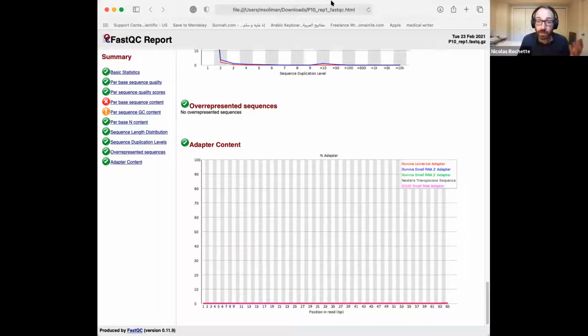Okay, so that's it for the FastQC report. One thing that appears here is that you might wonder where this goes. The thing is, here we're trying to rule out errors more than we're trying to guarantee that our data is what it should be. If we have really big artifacts, then we're going to see them. If we have small artifacts, we might have a doubt about something, but we can just keep going with the analysis, and maybe we're going to remove that one sample later. So essentially we're looking for an absence of bad patterns more than we're looking for specific patterns.